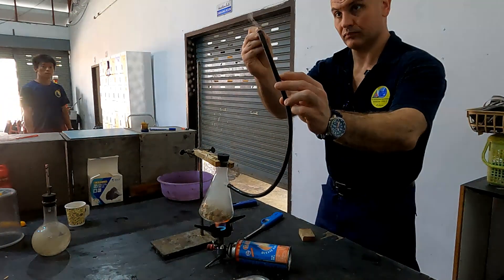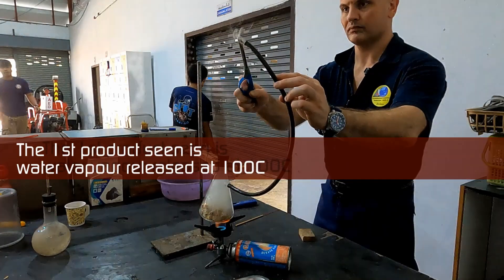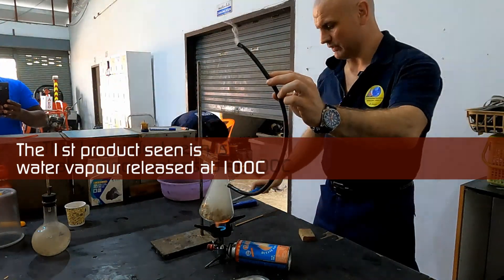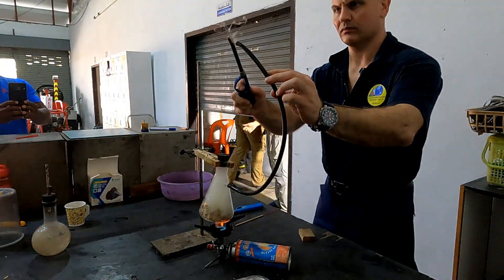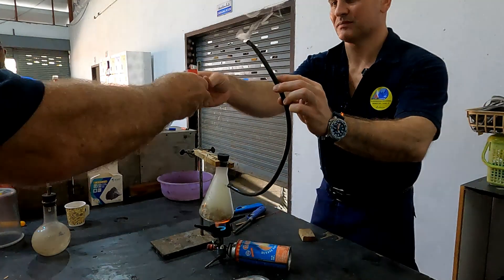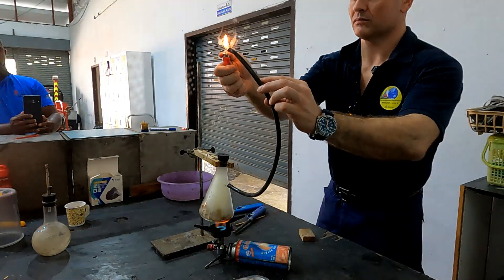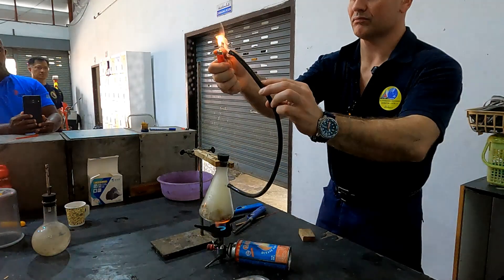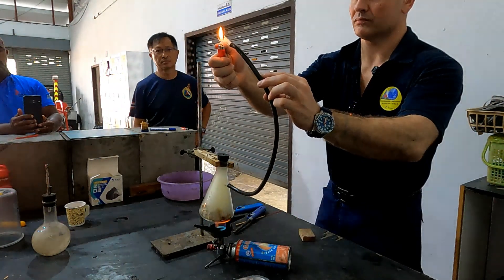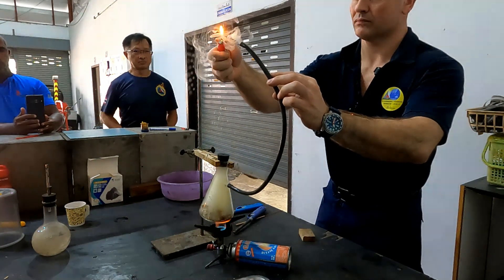Ben's going to see if he can light that. Notice that this smoke is disappearing because it's not smoke — it's steam, it's water vapor.